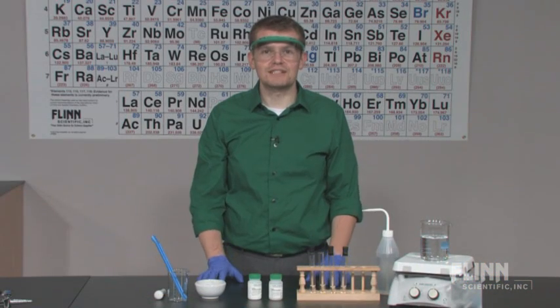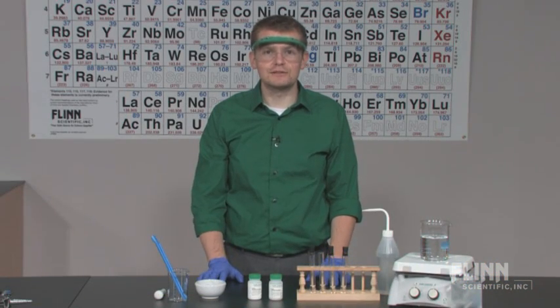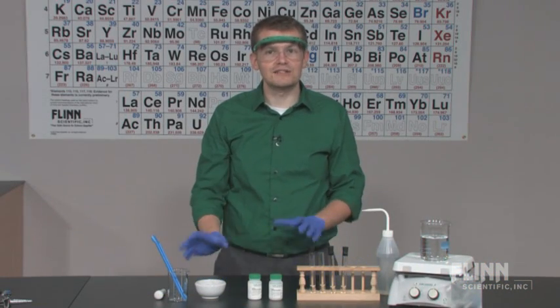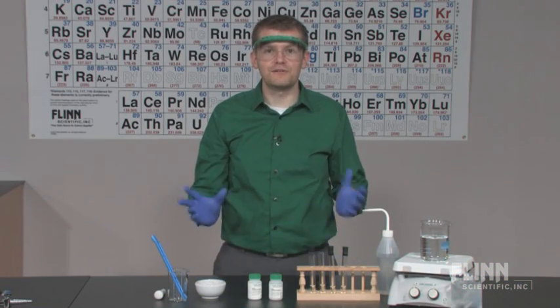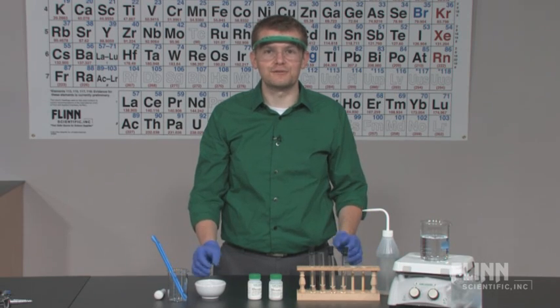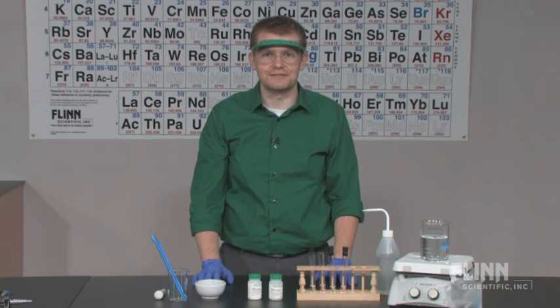Your students will discover there is more to solution-making than a solute and solvent with the Factors Affecting Solubility Lab Kit from Flinn Scientific.